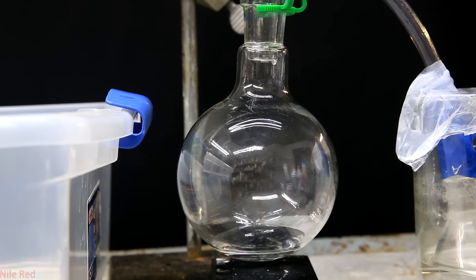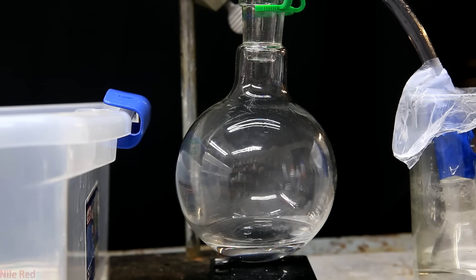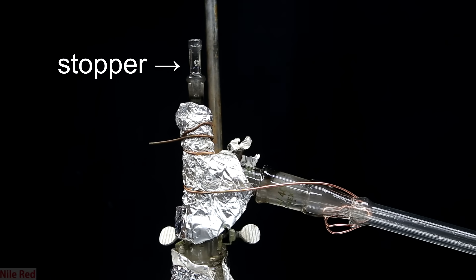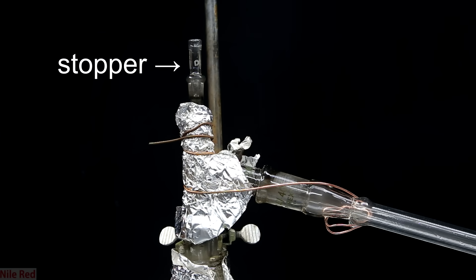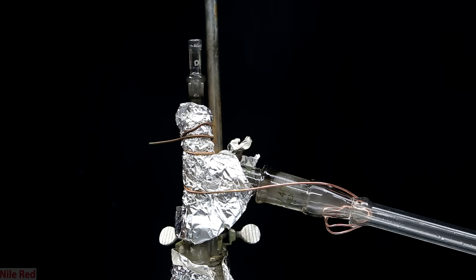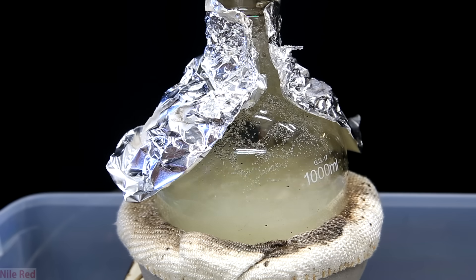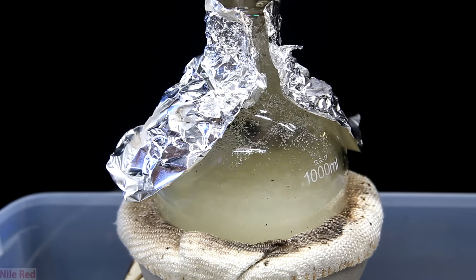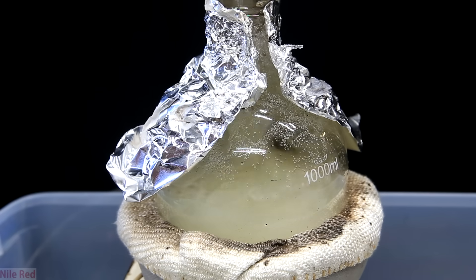Once this effect stops occurring, it means we're distilling 98% sulfuric acid, so I swap out the round-bottom flask for a larger one and start collecting everything until the end of the distillation. You can see there's just a stopper where a thermometer would normally be, and it's wired together using copper wire — this was because the bumping got so crazy at some point that it actually popped the joints apart. We can't use plastic Keck clips because they'd melt, and I didn't have any metal ones at the time. You can see just how crazy the boiling got despite all the sand and broken glass.